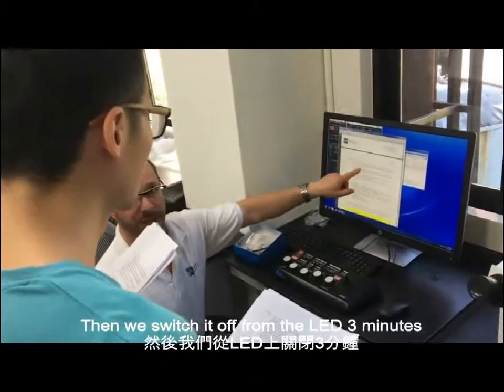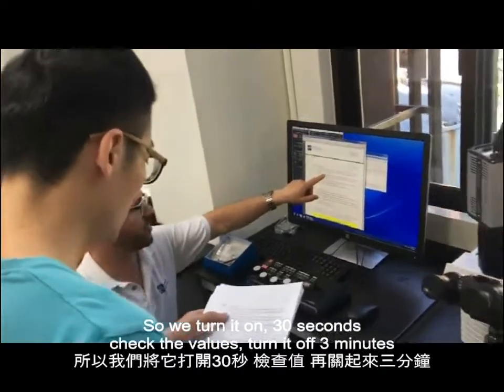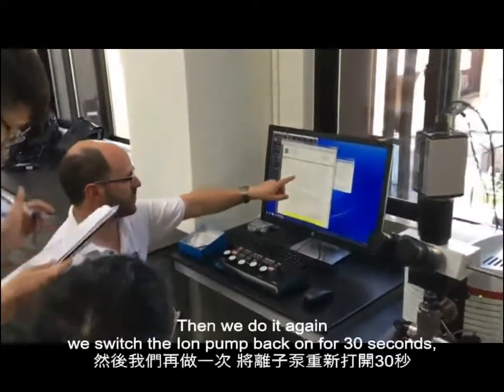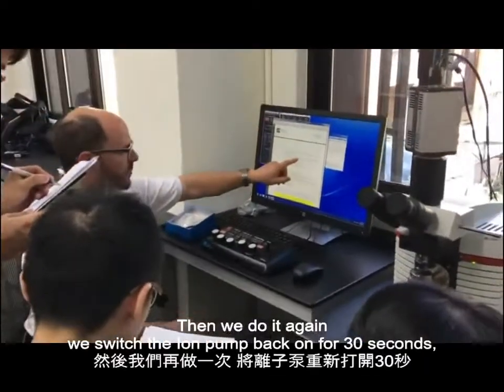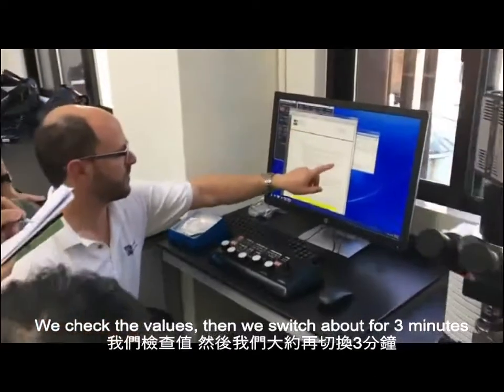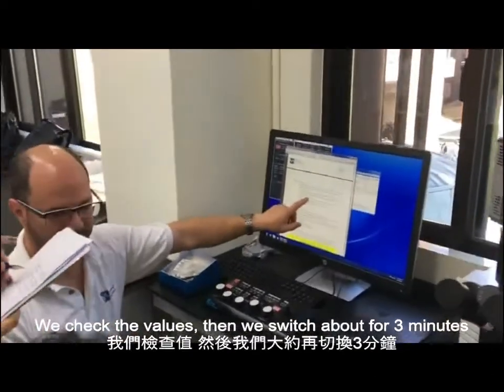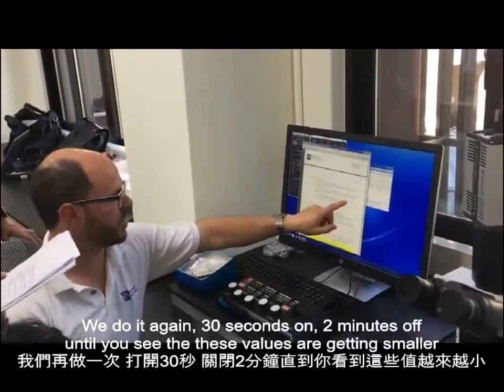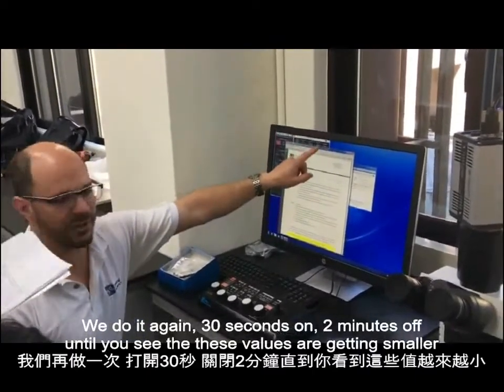Then we switch it off and we wait 3 minutes. Okay, so we turn it on 30 seconds, check the values, turn it off 3 minutes. Then we do it again. We switch the ion pump back on for 30 seconds, we check the values, then we switch it off for 3 minutes. We do it again, 30 seconds on, 2 minutes off, until you see that these values are getting smaller.